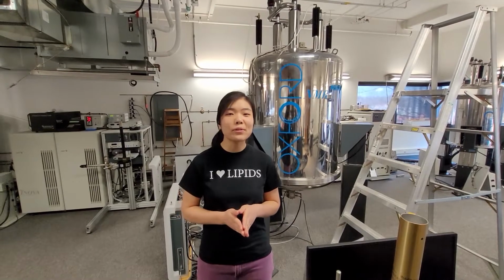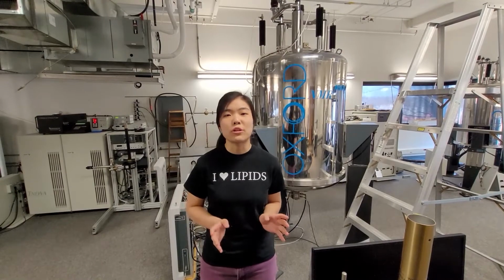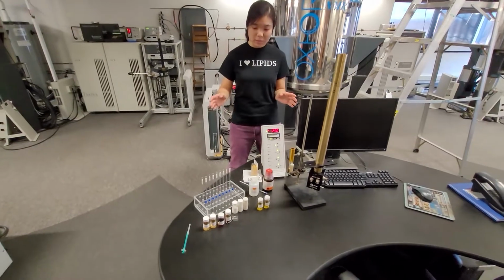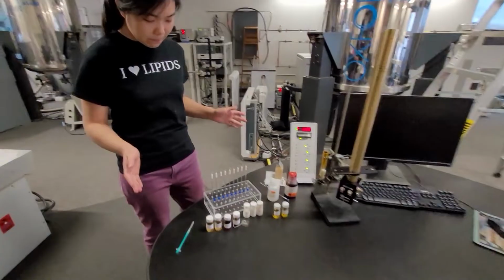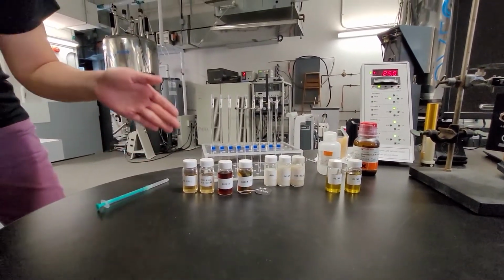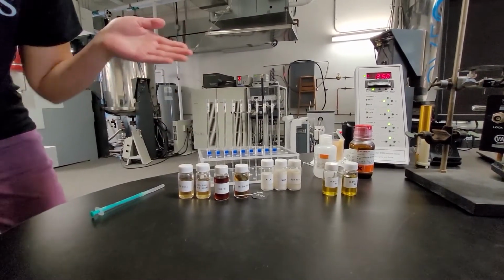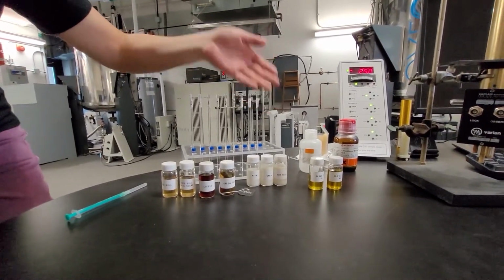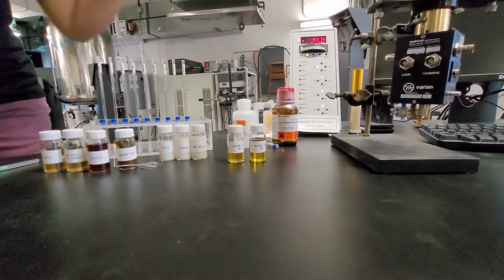Okay, so today we will show you one of the applications of NMR, which is to analyze complex mixtures. So on this bench, we have prepared several everyday items which we will analyze. So we have divided them into three groups. In the first group, we have two kinds of energy drinks with and without sugar. We have coffee and we have green tea. In the second group, we have milk, cream, and soya milk. And over here, we have two different kinds of olive oil. So let's get started.